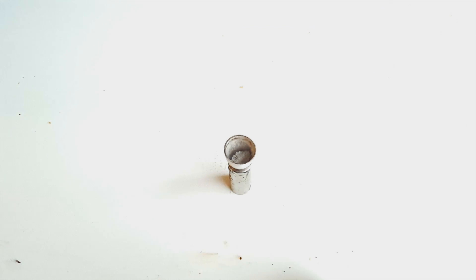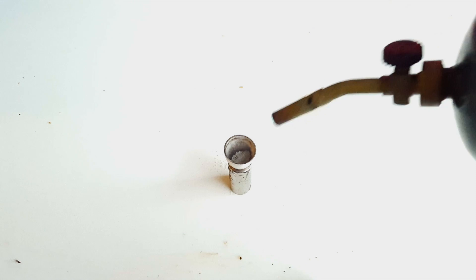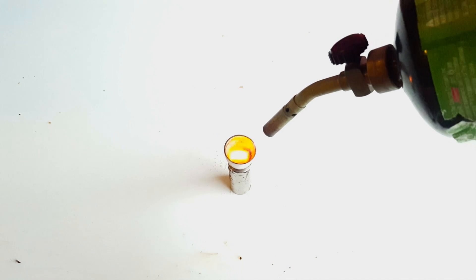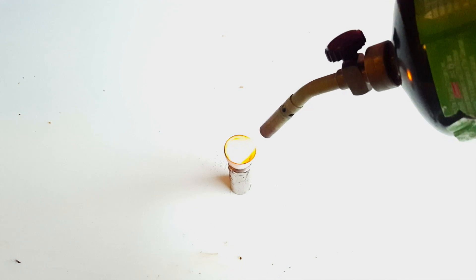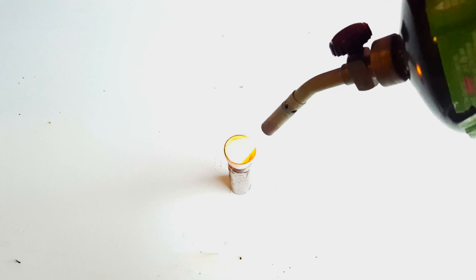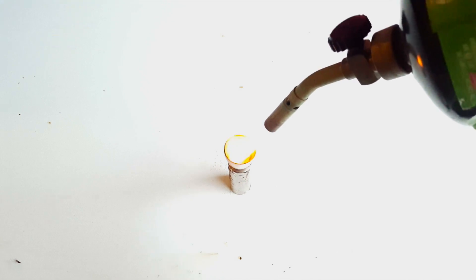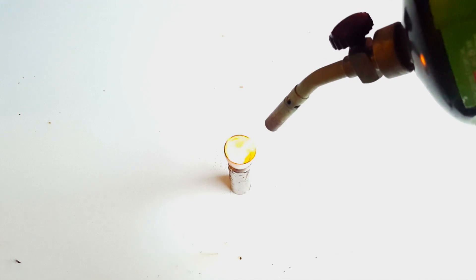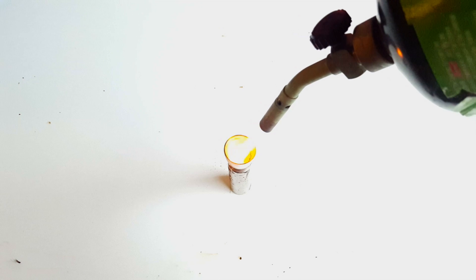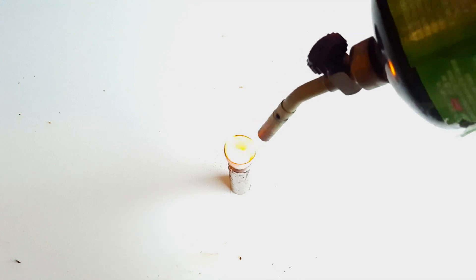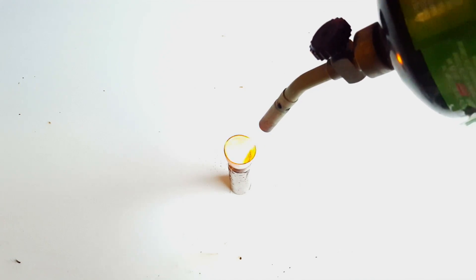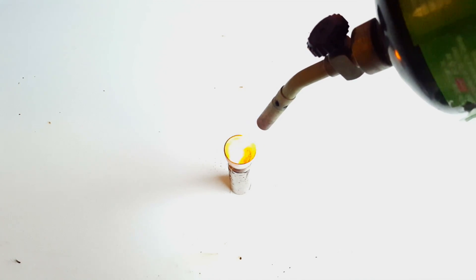So, what might happen if you put a gummy into molten sodium chloride instead of molten sodium chlorate? First, I melted the sodium chloride in a small crucible that I had with the exposure on the camera all the way up so that it could be seen. This took significantly longer than melting the sodium chlorate, which does so at a much lower temperature.